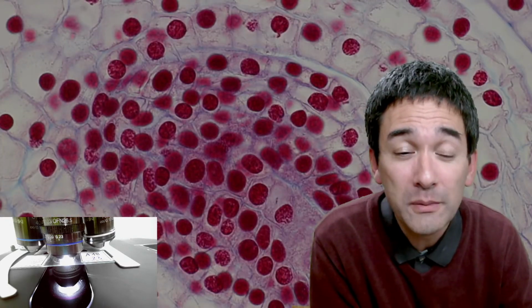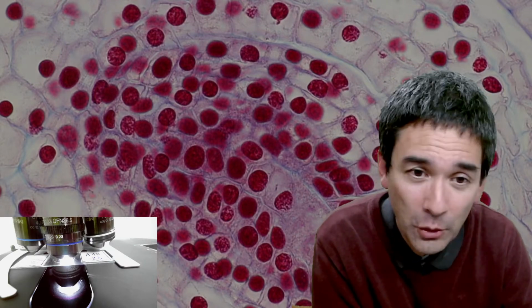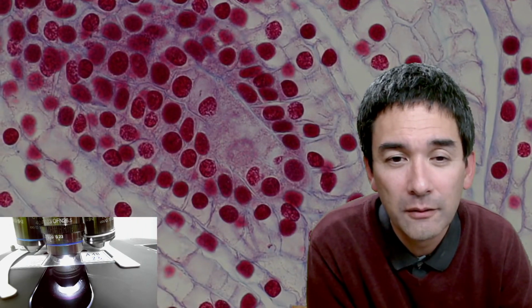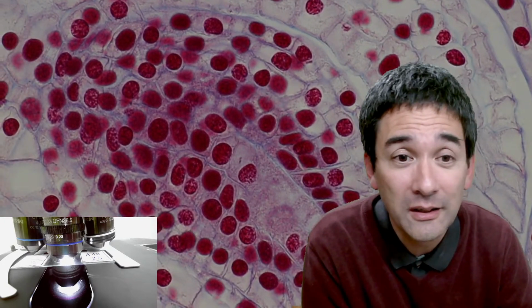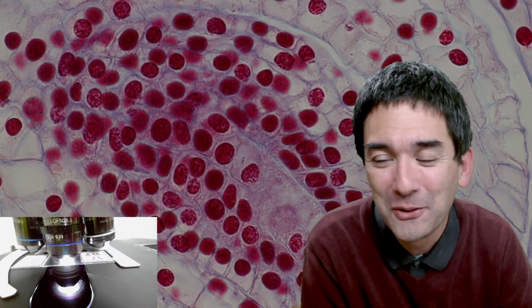It's much easier for me to simply show you for 1 hour stuff under the microscope, to simply have a little bit of a talk like this. And this is sometimes not possible in a classroom setting. For this reason, I feel that those YouTube live streams and the open possibilities are really unimaginable to me up to a few years ago.